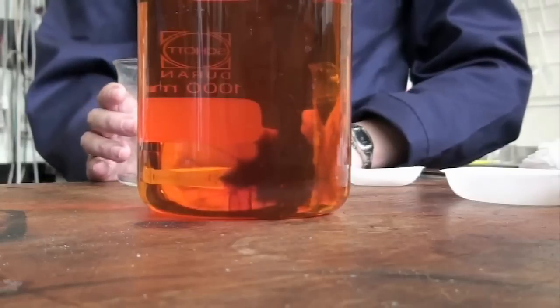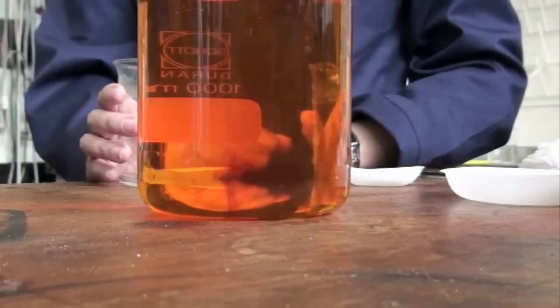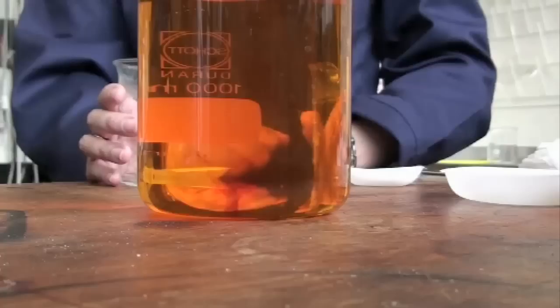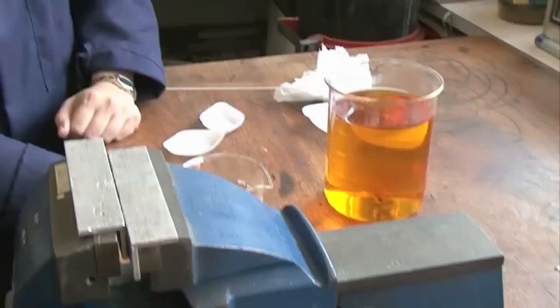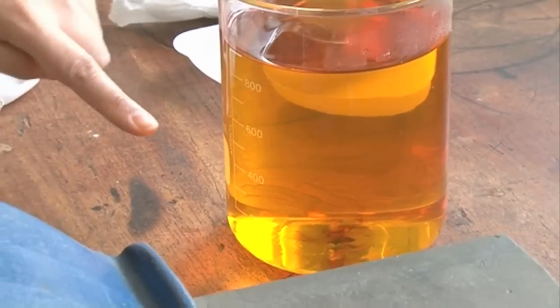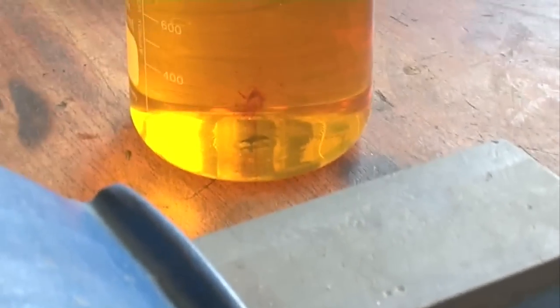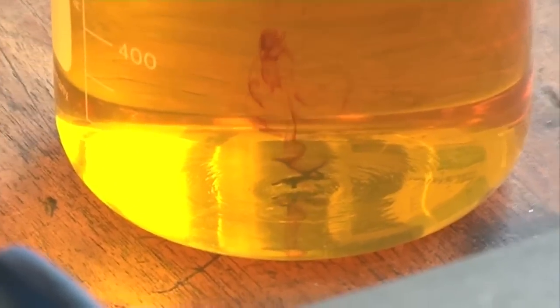Following that will be an amber, and we'll leave it to go to completion. Its final color change will be to yellow. You can actually see some of it isn't dissolved and you can see where the color is coming up from the bottom. That's really cool.